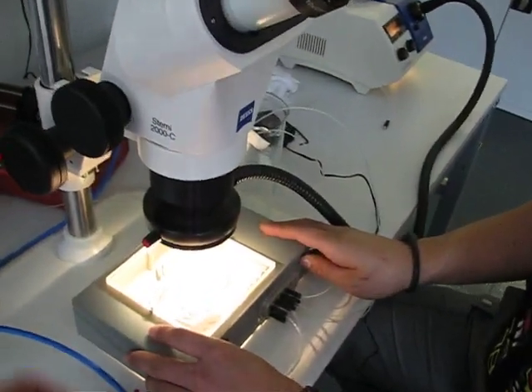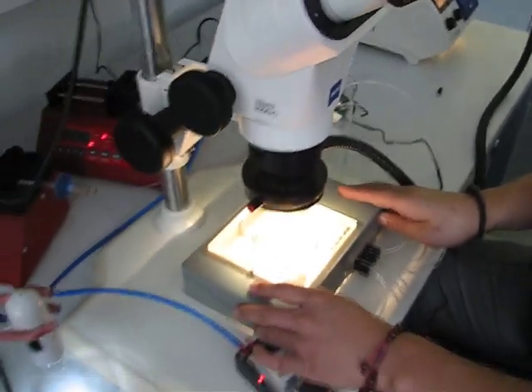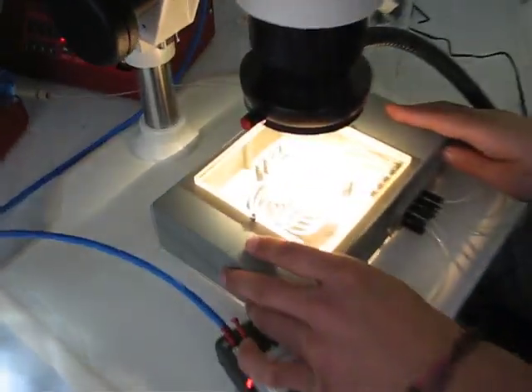And I just put a coin if you don't mind. Just to give us perspective on the scale.